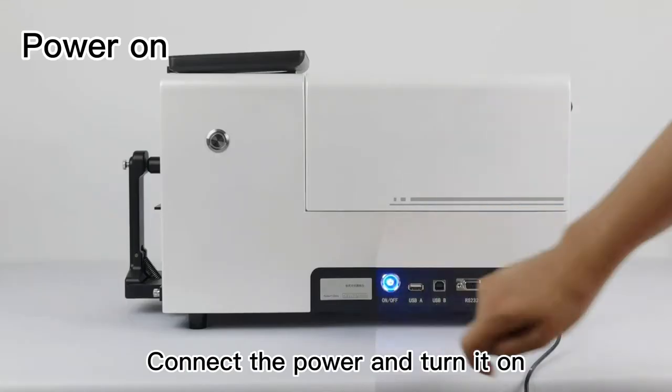Start up the instrument: Connect the power and turn it on.